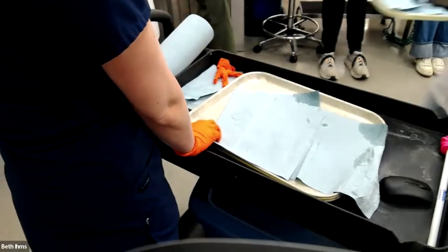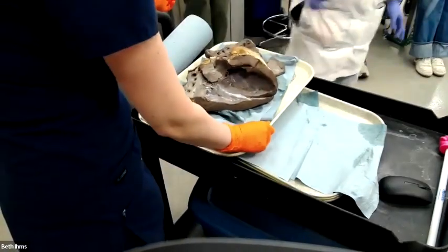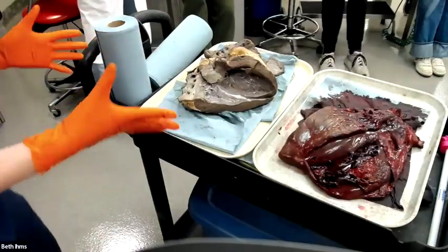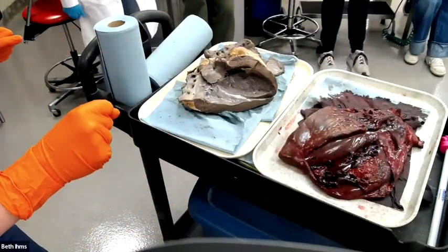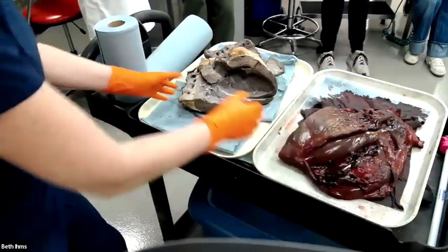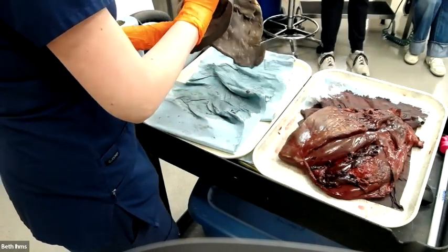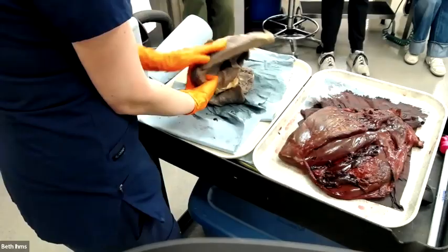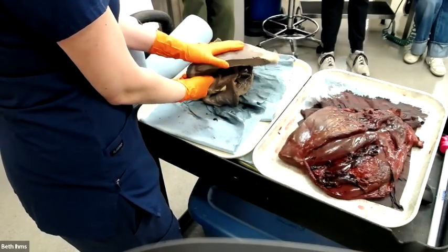Exotic things have a coelom, no diaphragm, coelomic cavity, C-O-E-L-O-M. Nice. All right. This one's important because this illustrates a concept that we're going to be coming back to all quarter. I'm gonna show you things everywhere on the spectrum between these. This is extremely fixed. This has been sitting in formalin probably for a week or more. Look how different the color is. This is no longer the colors of life. This is now like an anatomy specimen.